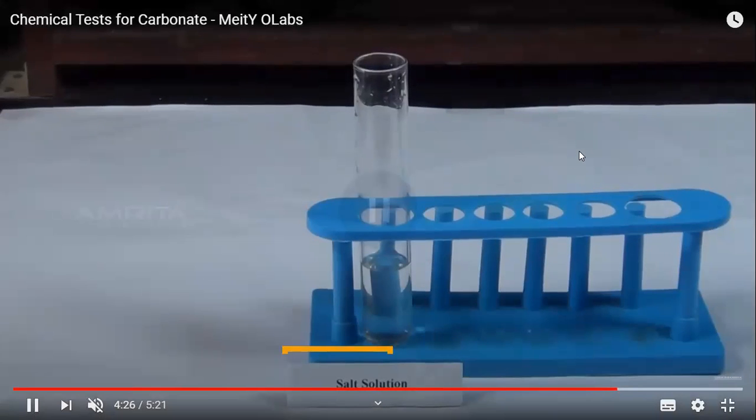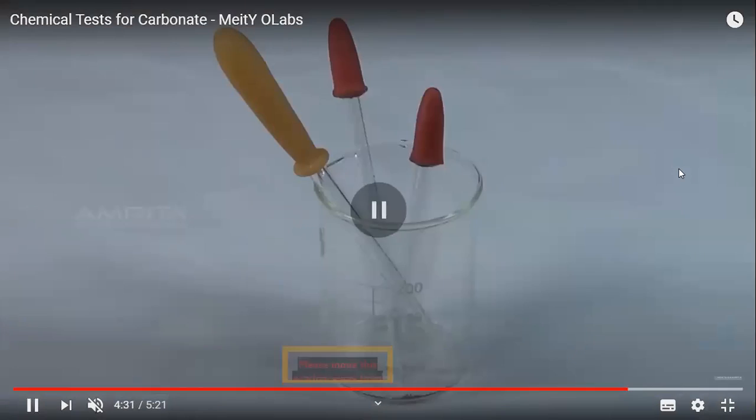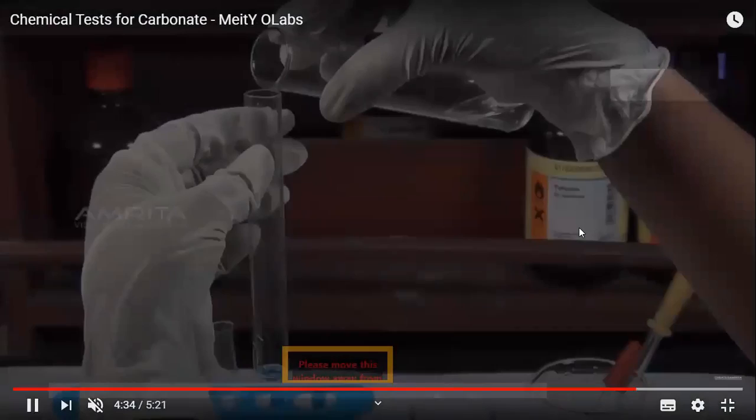For the magnesium sulfate test, my dear students, let us see what materials are required. We need the original solution, that means the solution of the salt in an aqueous medium or in distilled water. Then we need magnesium sulfate solution. Then we need the various test tubes and the droppers. Let us perform the magnesium sulfate test.